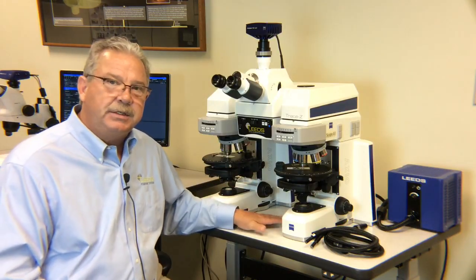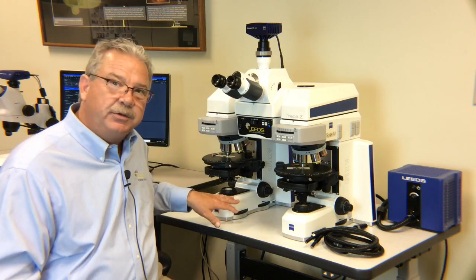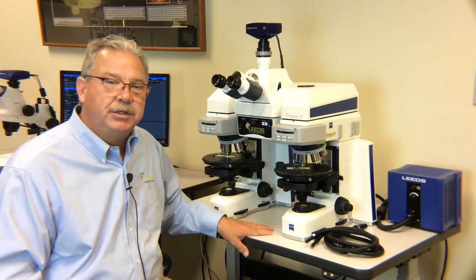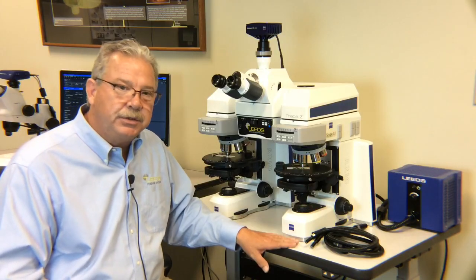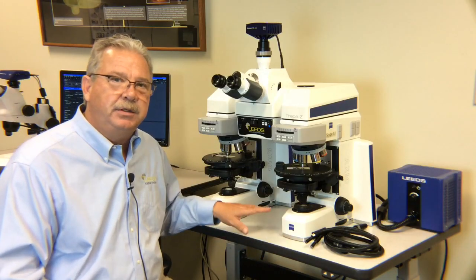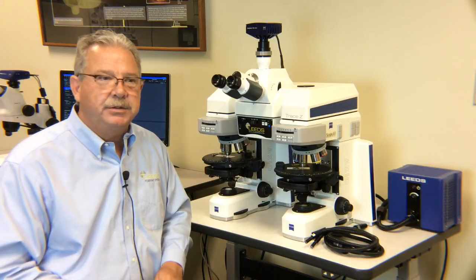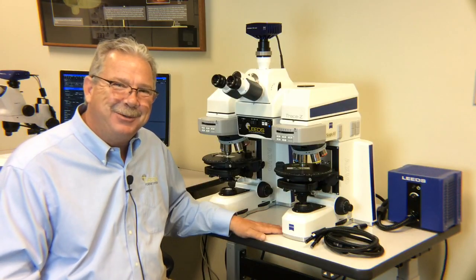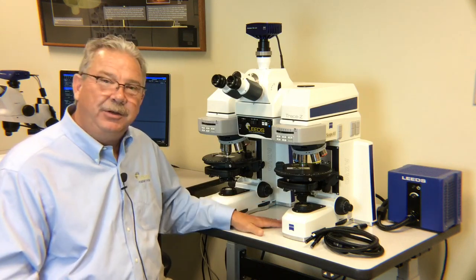We build you a complete system from the top on up. We color match the left microscope, we color match the right microscope, and then through fine filtration, we balance the two images. Again, color and intensity are huge to a trace examiner, and even more so in modern times because we're bringing so many pictures to court. A jury sees two slightly different background colors and they start imagining things. We'd rather have them listening to the expert and looking at the pictures than trying to figure out what's going on here. It's a very unique thing that we do.